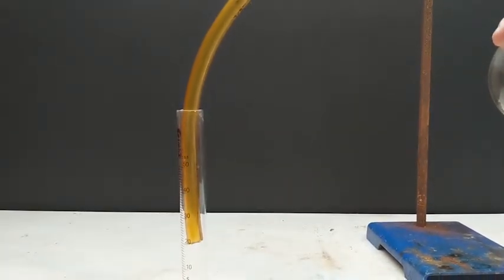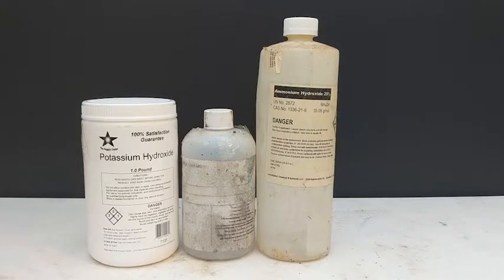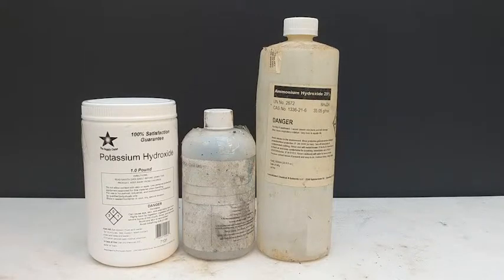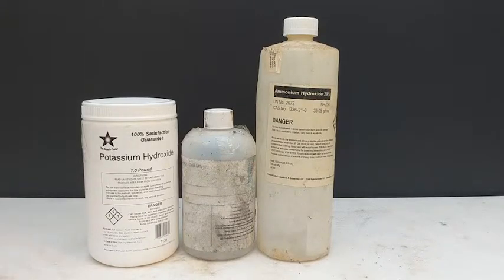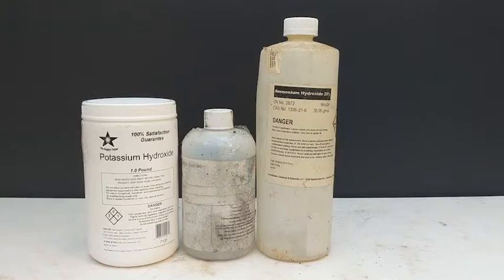As you will soon see, our lack of experience with ammonia has led to a spectacular failure in the lab. Let's get started.